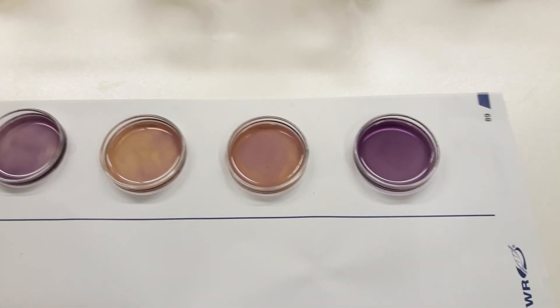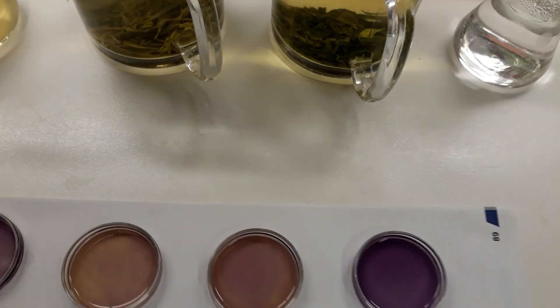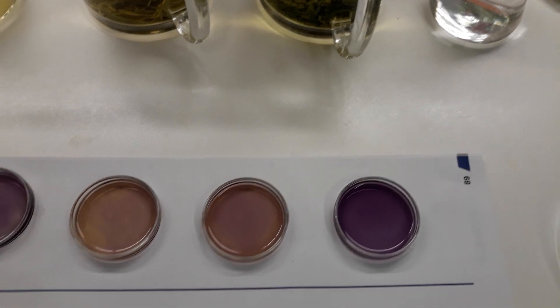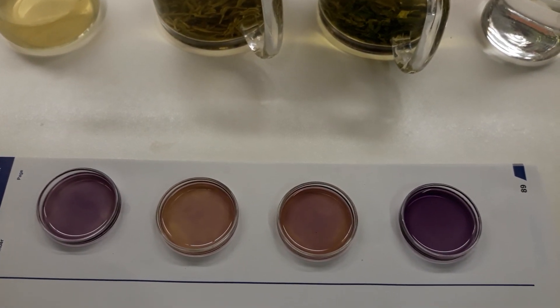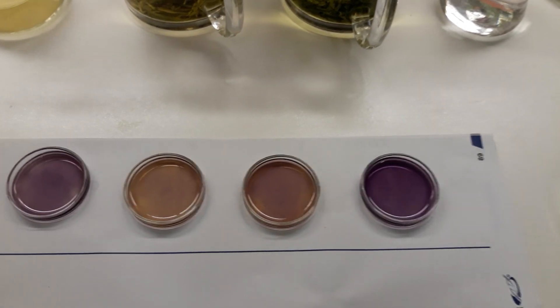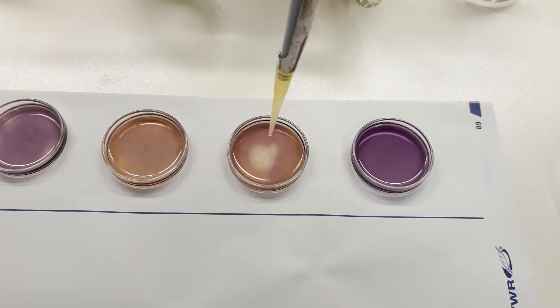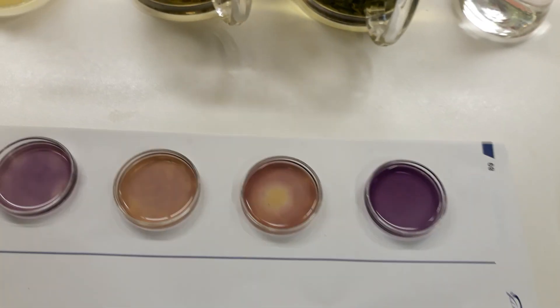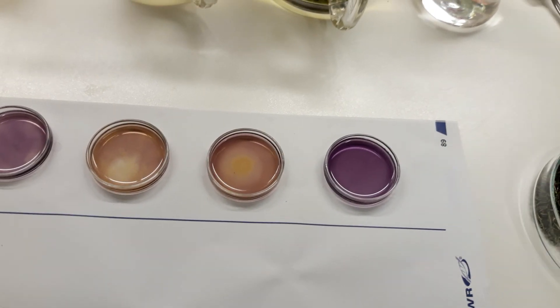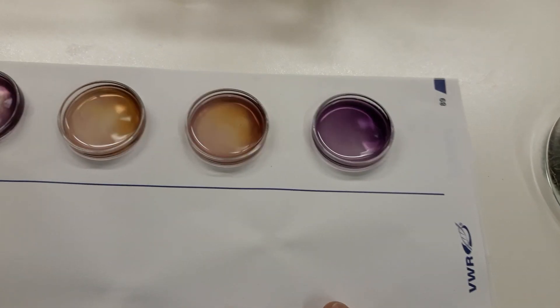but not as pronounced as for the real green teas, and of course that's natural because only maybe two or three grams of plant extracts or green tea extracts have been added to that sample. I will add another 100 microliters of my Japanese and another 100 microliters of my Chinese tea and we will see again how the reaction takes place.